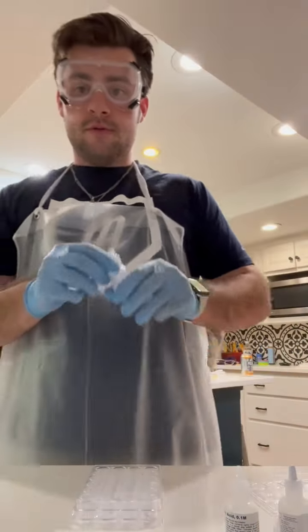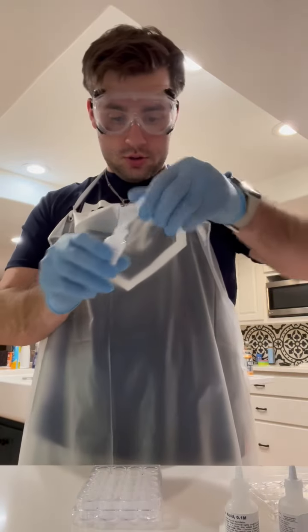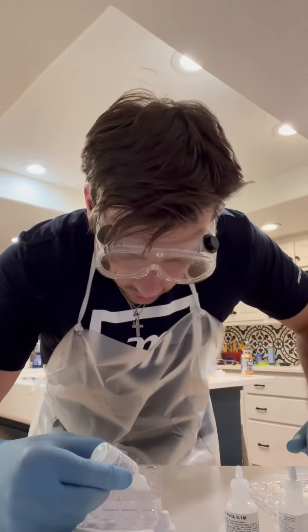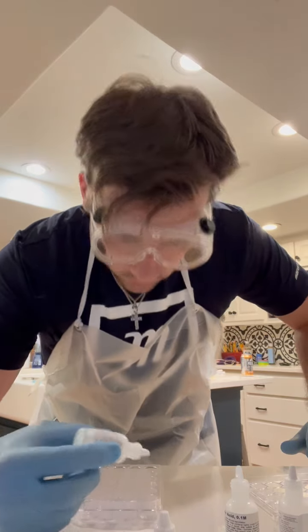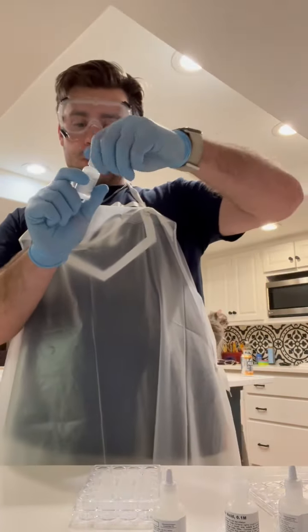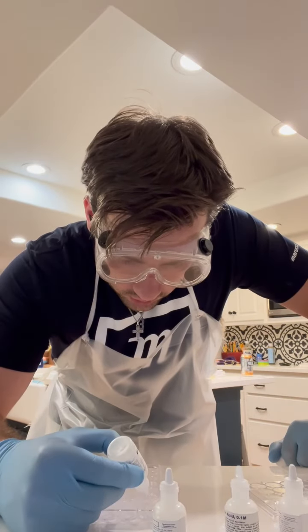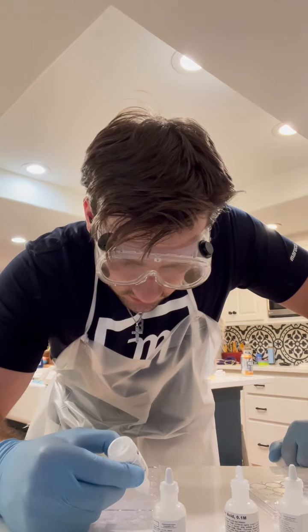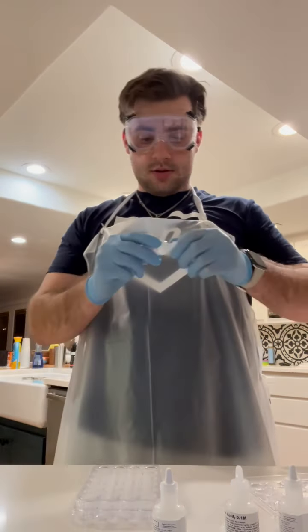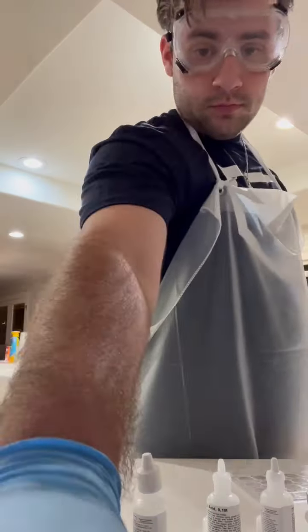1, 2. 4 drops of starch. 1, 2, 3, 4. And 8 drops of sodium thiosulfate. 1, 2, 3, 4, 5, 6, 7, 8. All right. Then I mix it together.